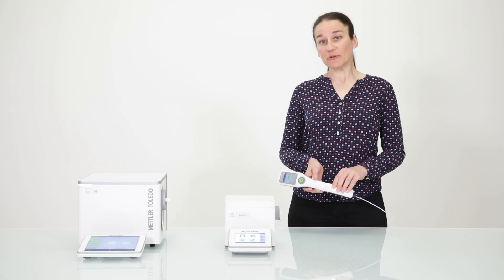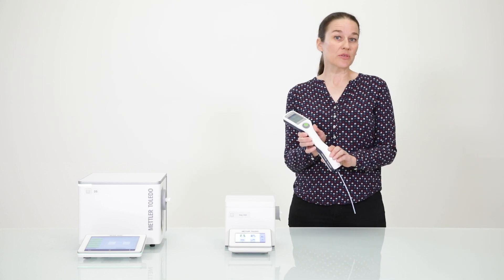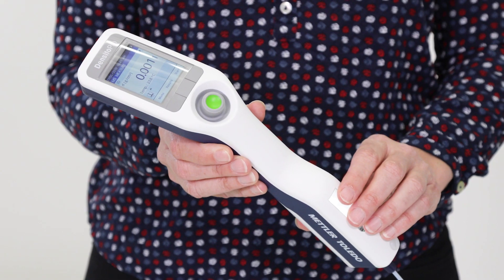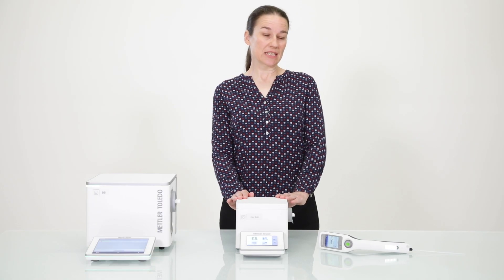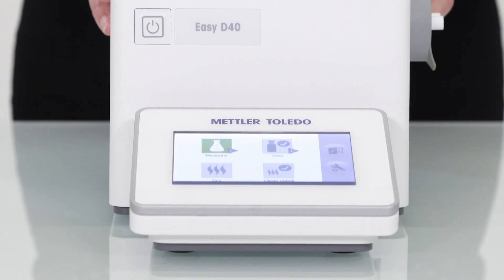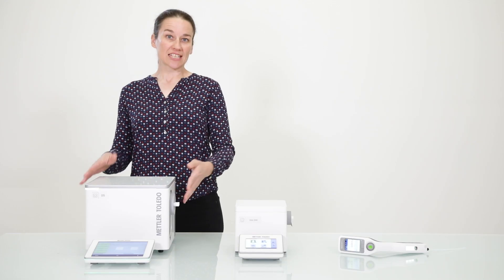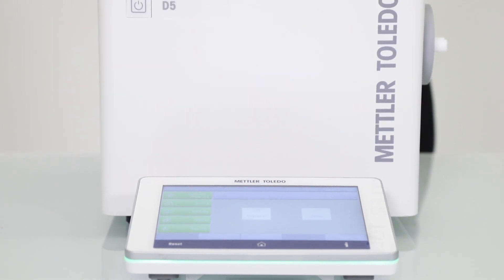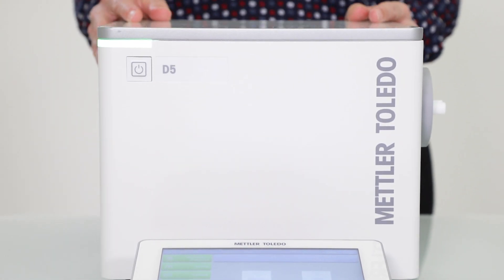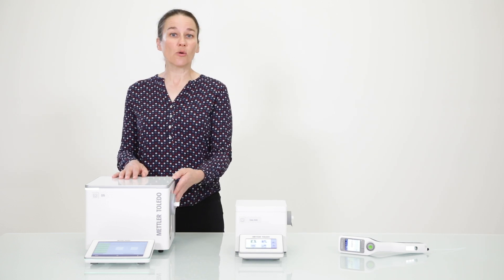Mettler Toledo offers different digital density meters depending on your needs. The handheld density meter can be used in the field or in the lab — it doesn't offer temperature control, but results can be temperature compensated. The standard line benchtop density meters have built-in temperature control and are great for quick measurements in production or in the lab. Finally, the excellence line benchtop meters — the top-of-the-range models — are used for high-accuracy measurements up to six decimal places, also with built-in temperature control.